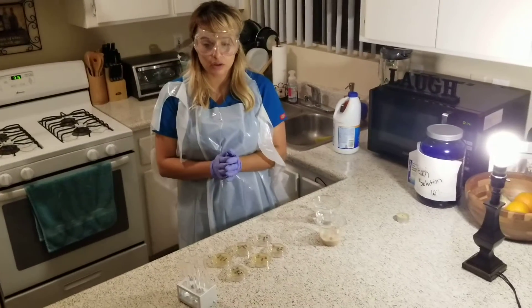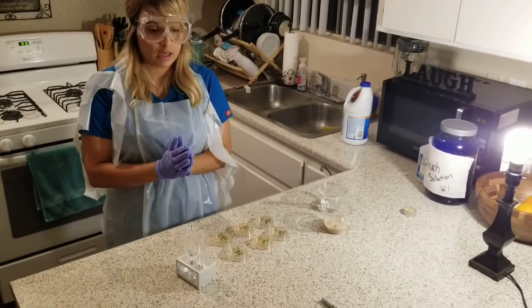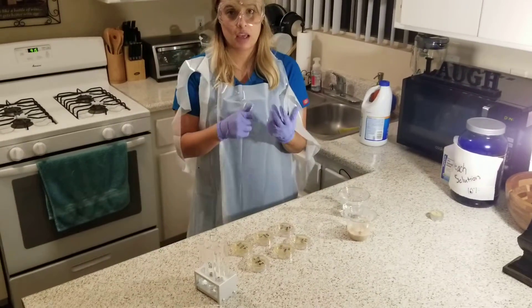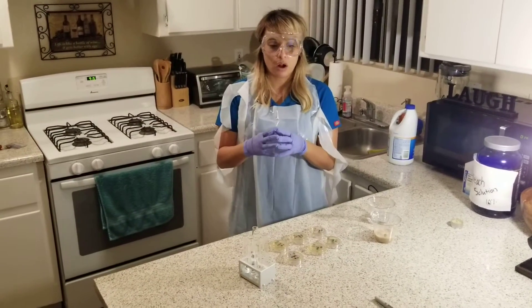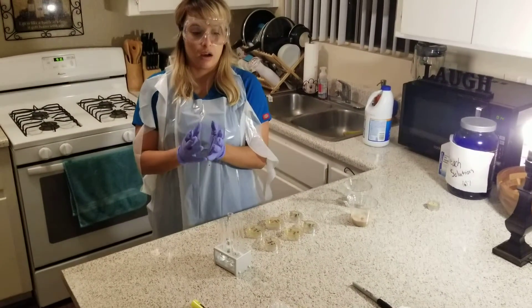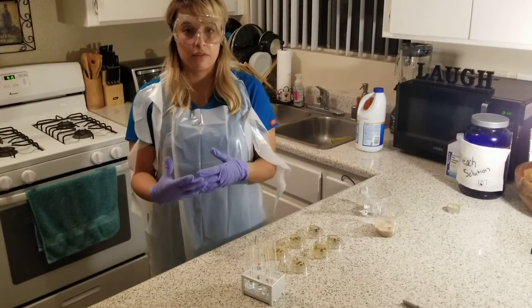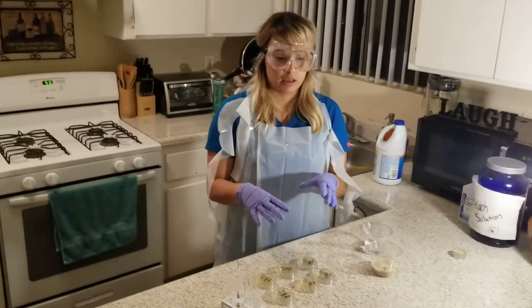The lab experiment is called bacterial enumeration dilution. In this experiment, I will be showing the exponential growth that microbes go through through binary fission, meaning that one single cell will divide into two, creating multiple colonies. An example of their exponential growth is over a period of 30 minutes, a certain amount of colonies will form, and over a period of 10 hours, there could be more than half a million microbes that could have formed.